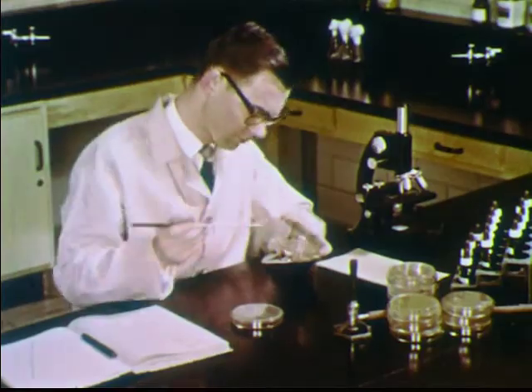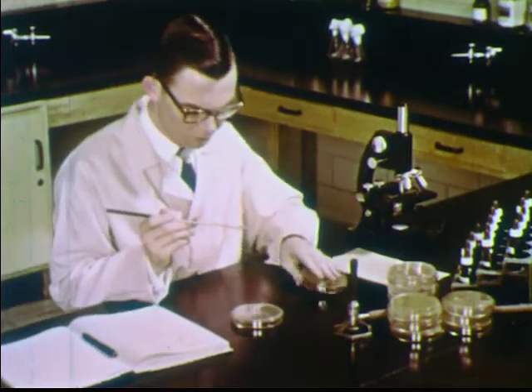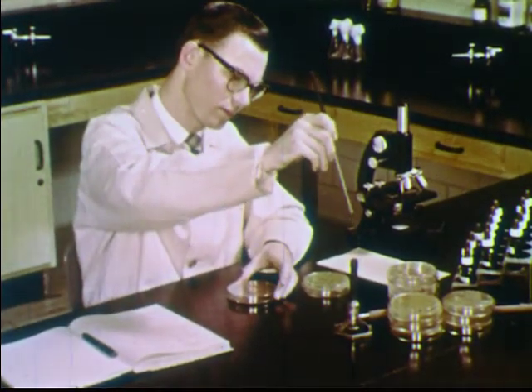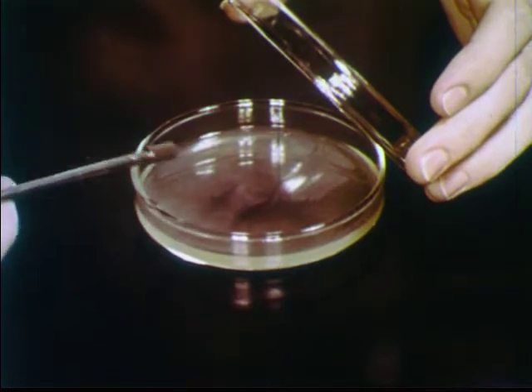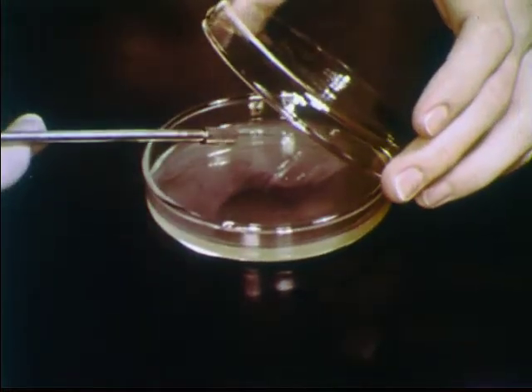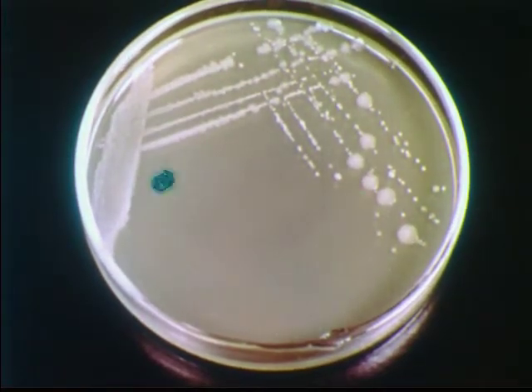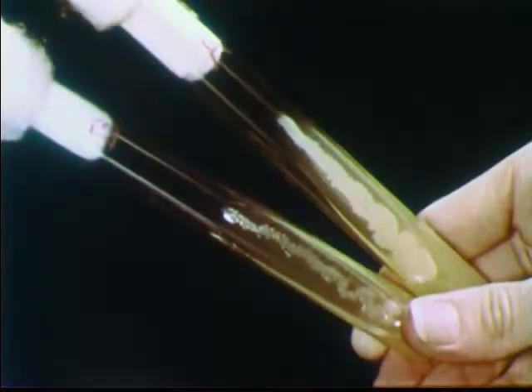To do this, a wire loop is touched to a portion of the mixed colony and streaked lightly across the surface of a sterile nutrient medium. After the loop is flamed, streaking is continued to distribute the cells. Following incubation, two types of colonies are observed separated on the last streaks. Specially stained smears reveal that each colony consists of a single type of bacterium. Each bacterium is now isolated and can be grown separately as a pure culture.